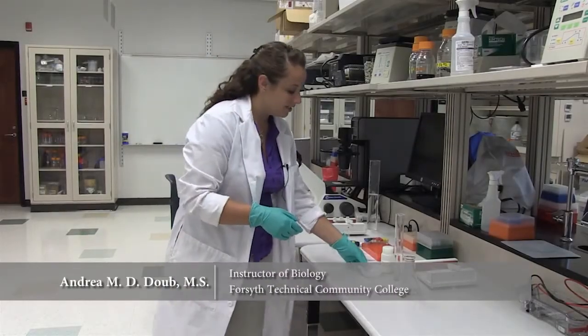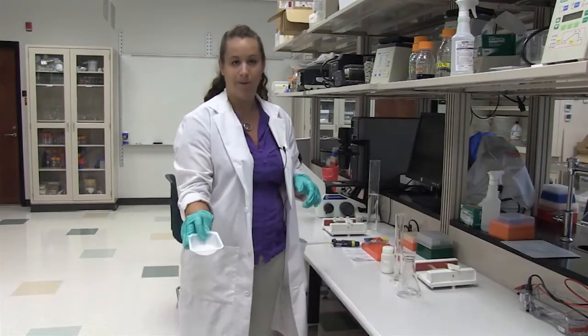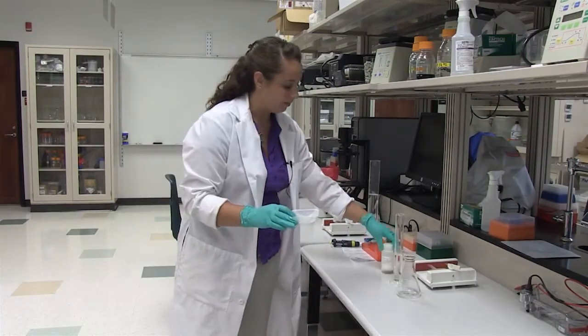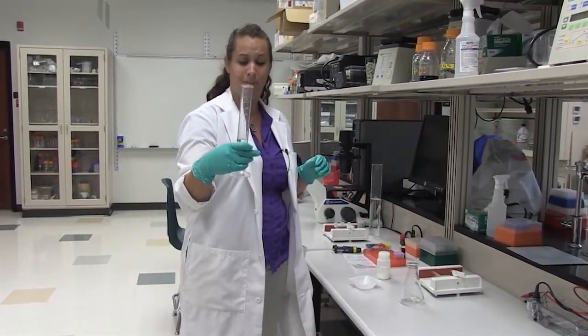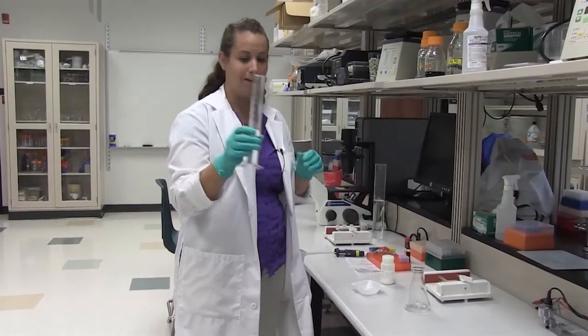The first thing we need to do is make our 1% agarose gel. We're going to measure 0.4 grams of pure agarose and we're going to have 40 milliliters of your prepared TAE buffer.